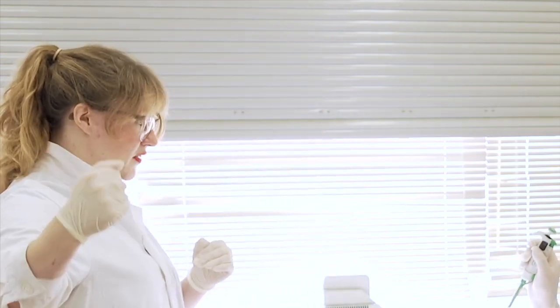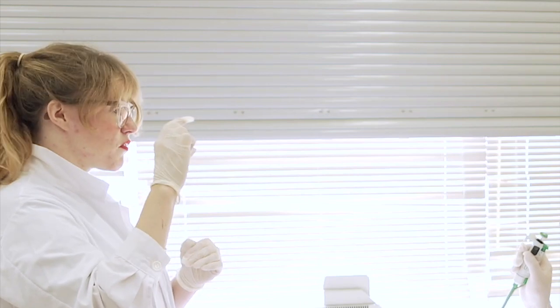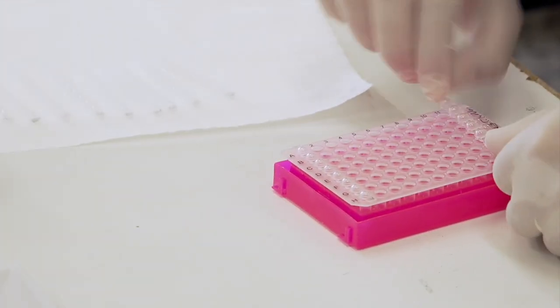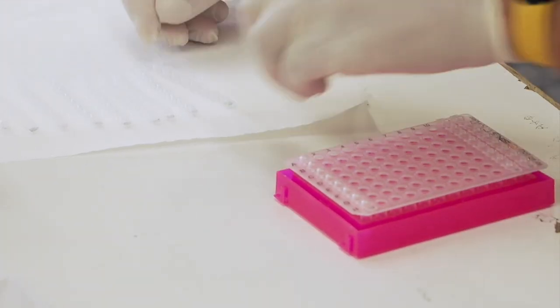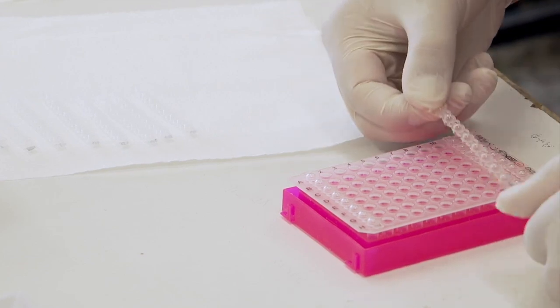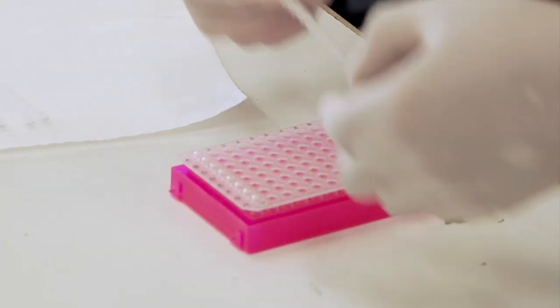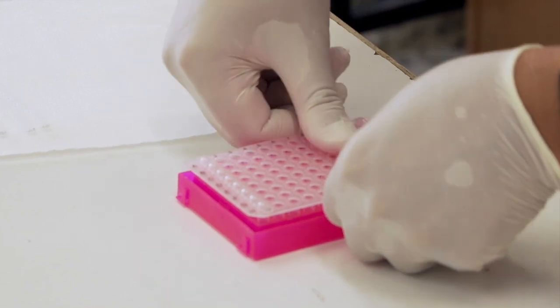When you do the transfer into the dilution plate, you only want to go for the top. So when the plate comes back down, you can start decapping this. When the plates come back down, they just need to make the dilution plate. And then we're done, but that's still going to take some time.